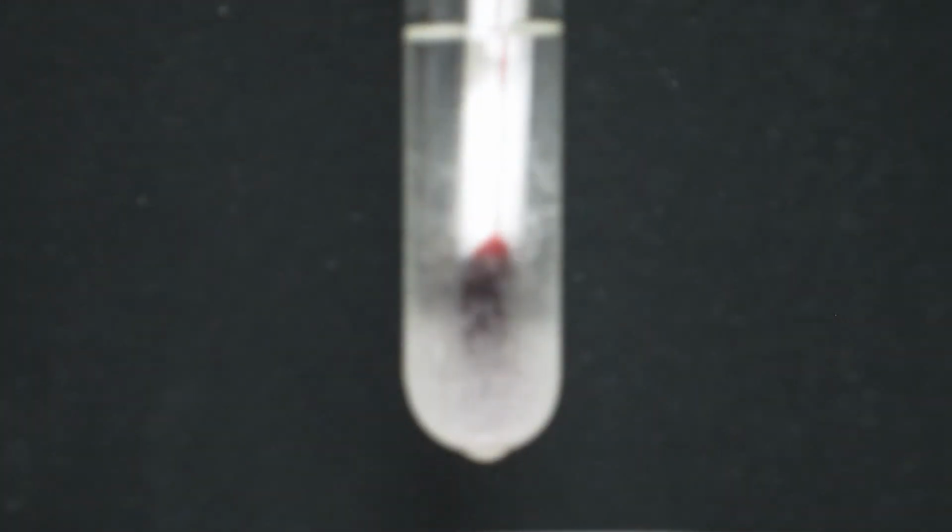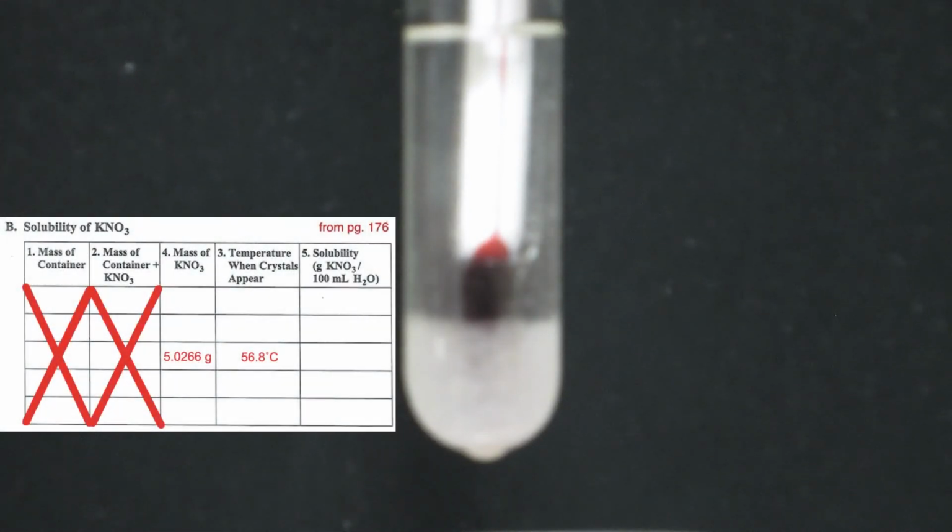And that's it. And so that data point will be used for, again, both the table and the graph in Part B. And then I'm not going to do the experiment for the other masses of potassium nitrate. I'll just share that data with you. And I think there are 5 total data points, then you'll be able to fill that complete table in and then also plot the graph for the solubility of potassium nitrate.